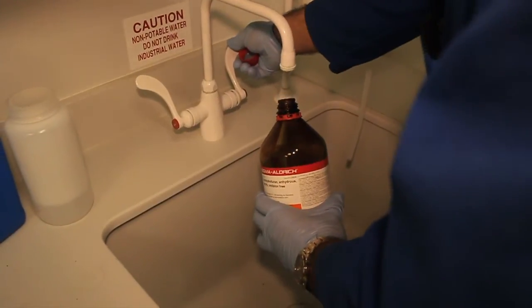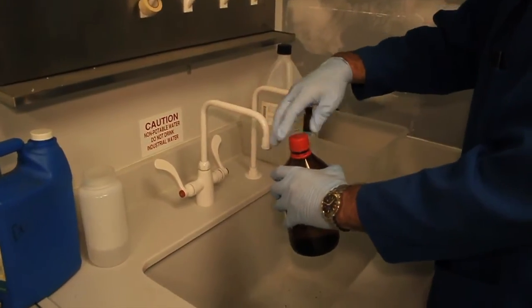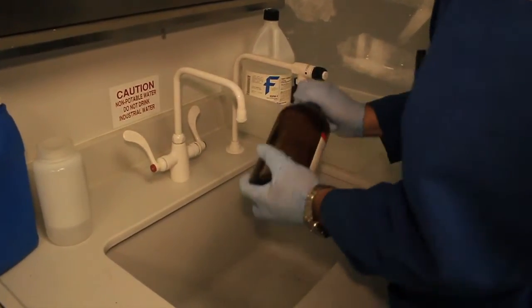Make sure the chemical that was in the bottle is not a water reactive chemical. If not, rinse out the bottle with a little bit of water. Shake it up to get all of the liquid residue out.